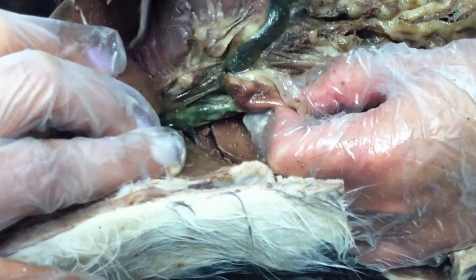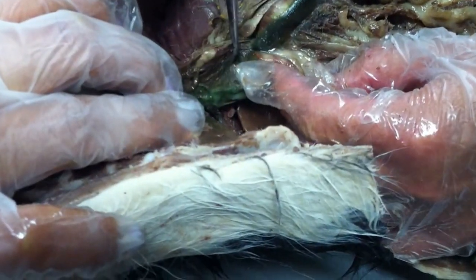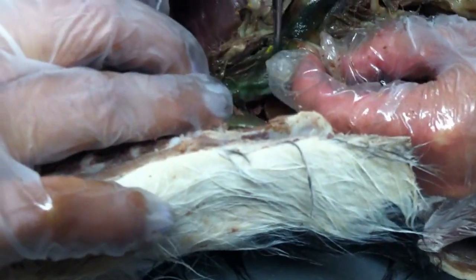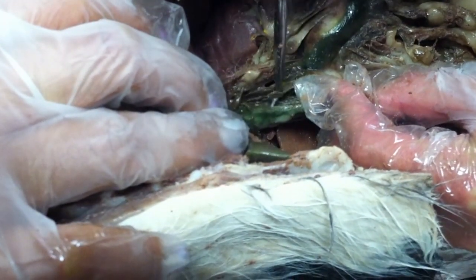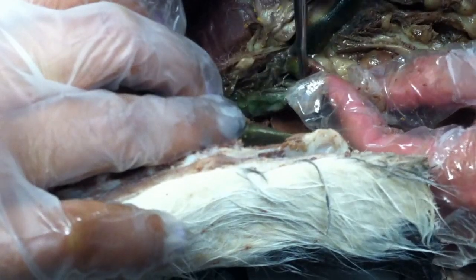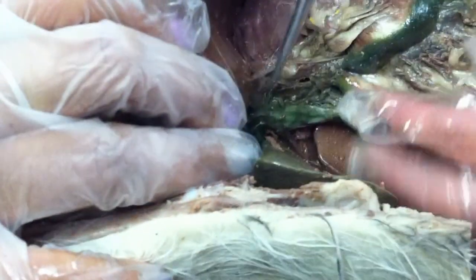It's not so easy, huh? This fat. I tried to get mine clean. We need to break some of these membranes. It's all over my face right now. You don't have a thing to pull it back? What are you looking for down there? There should be a duct from the liver. That's called the common hepatic duct. But I guess it's not very clear on this one.